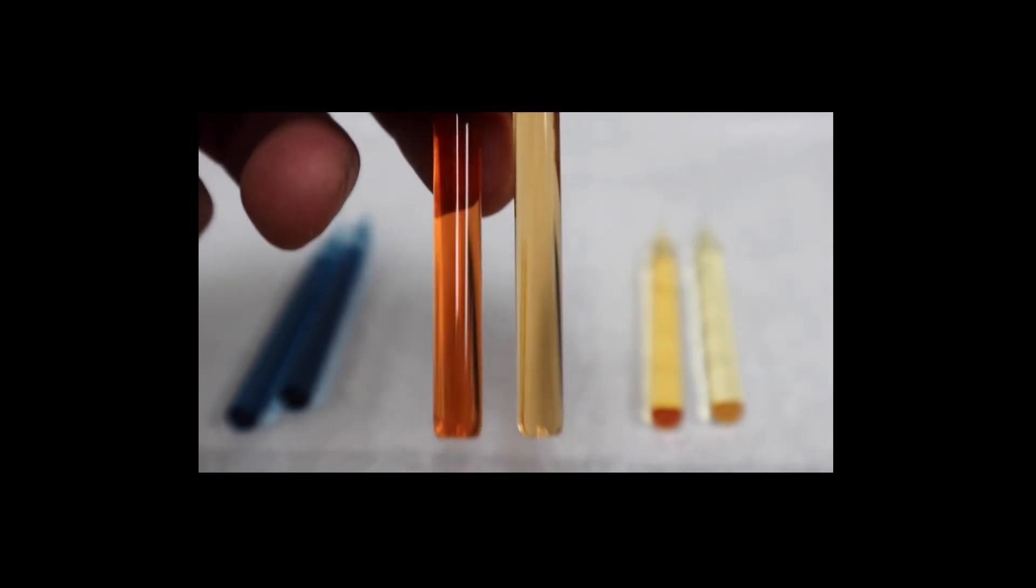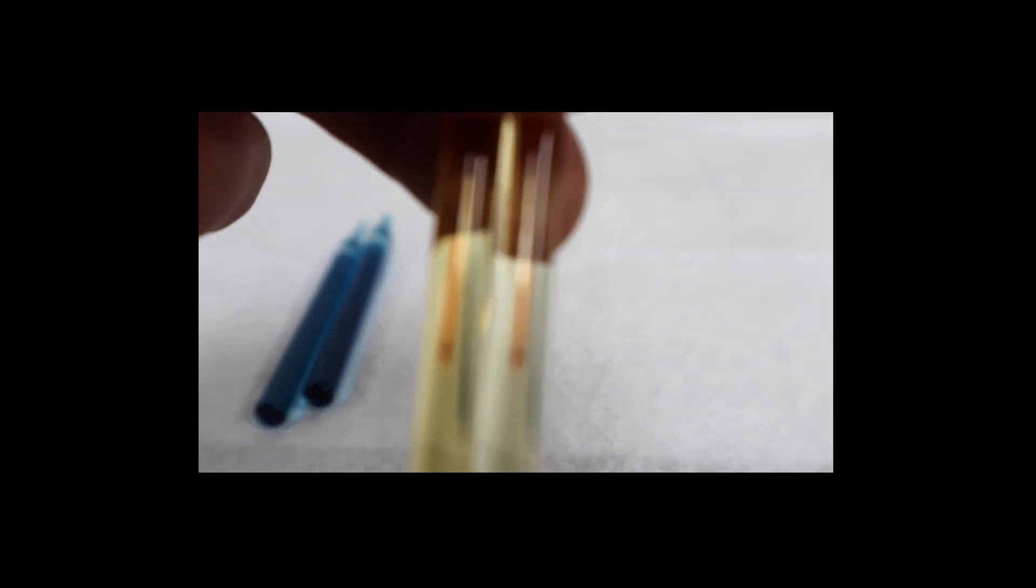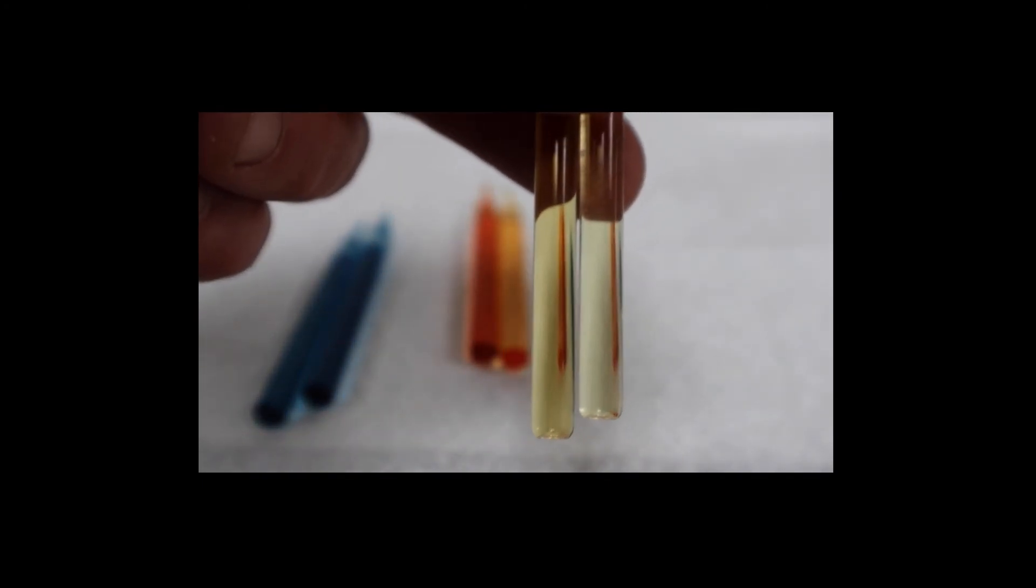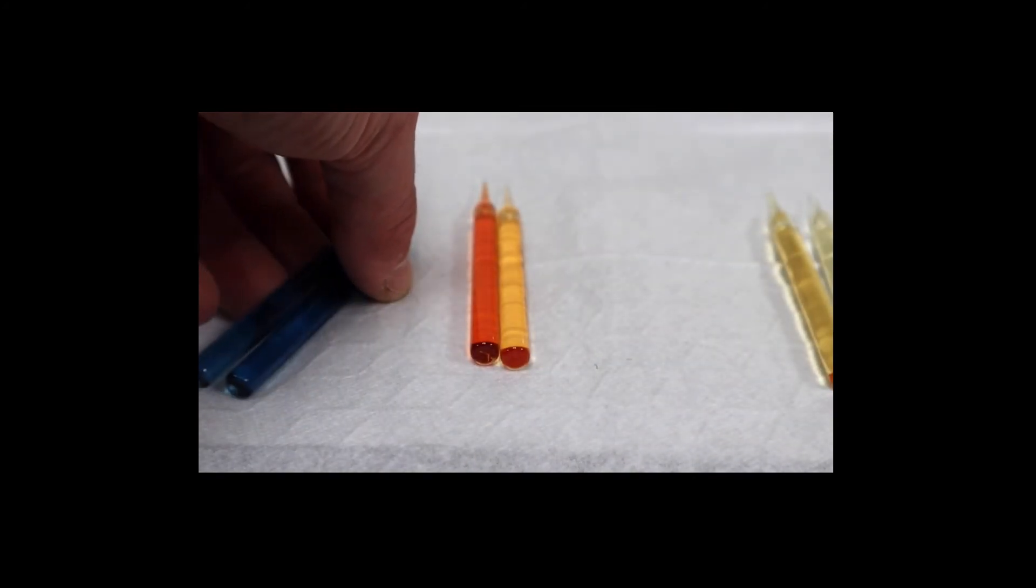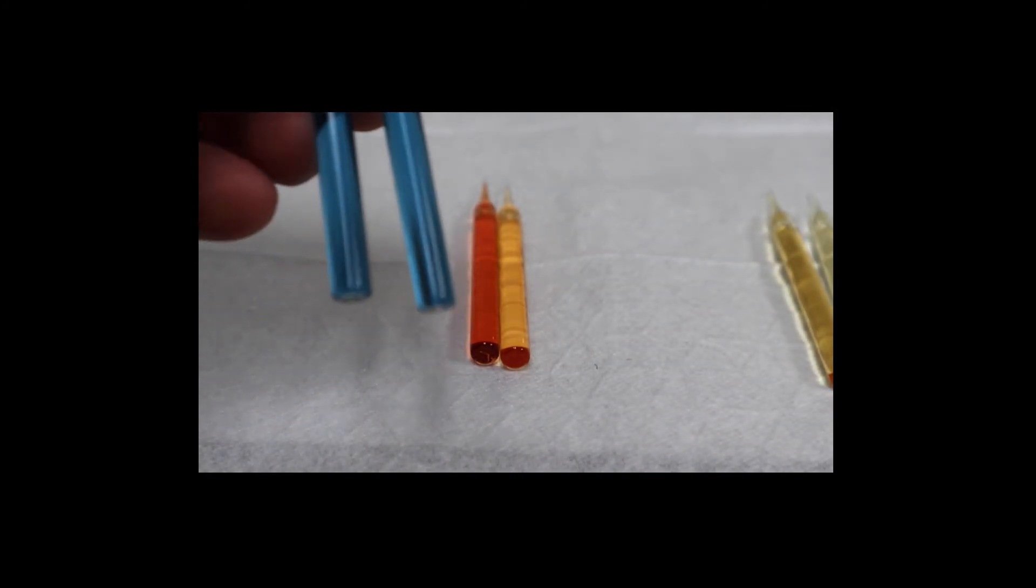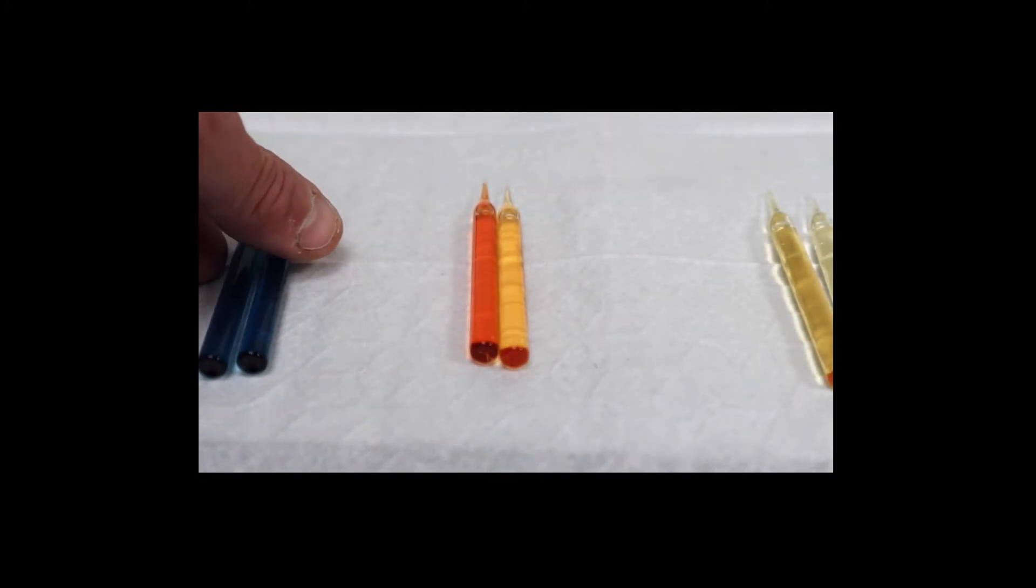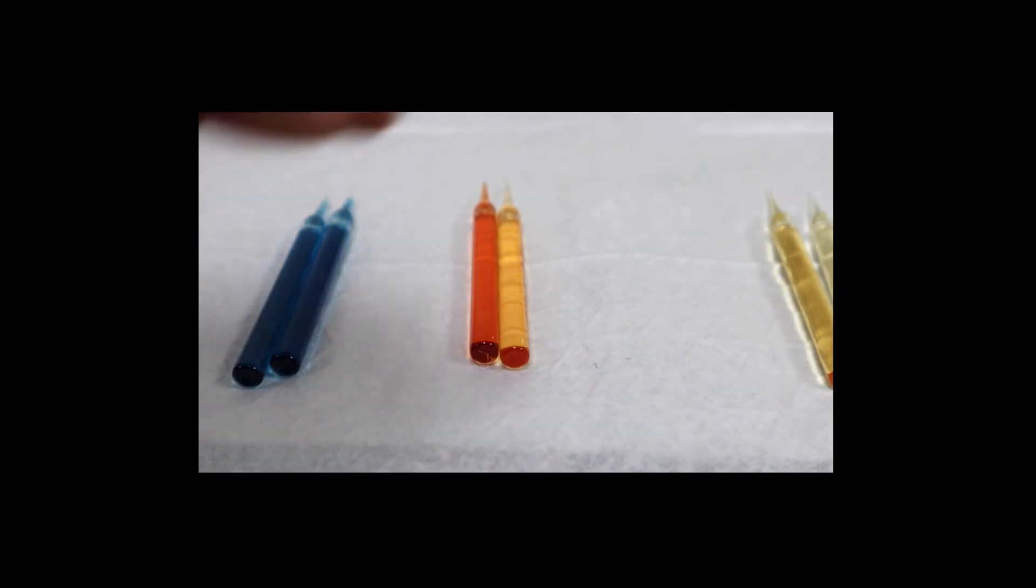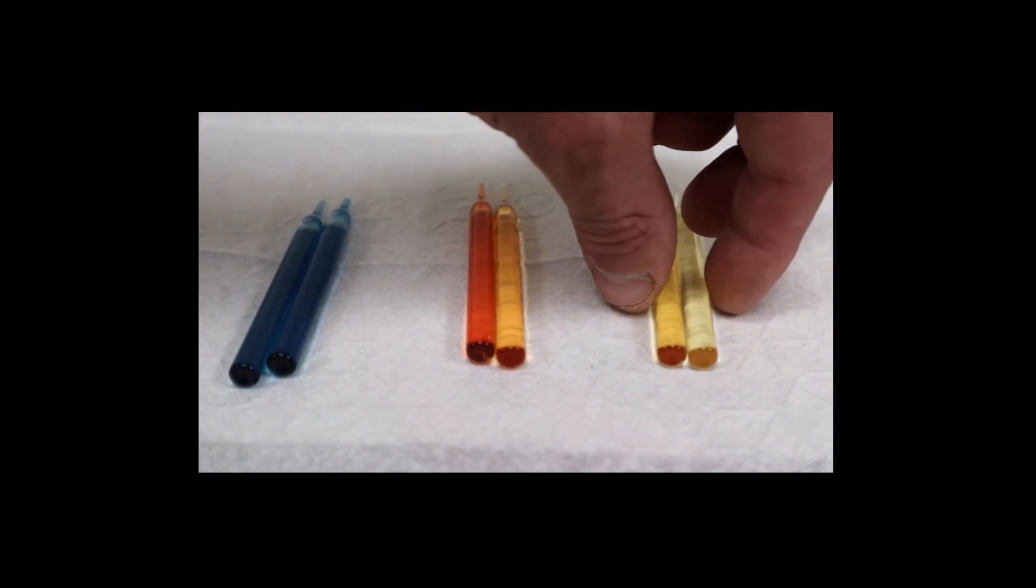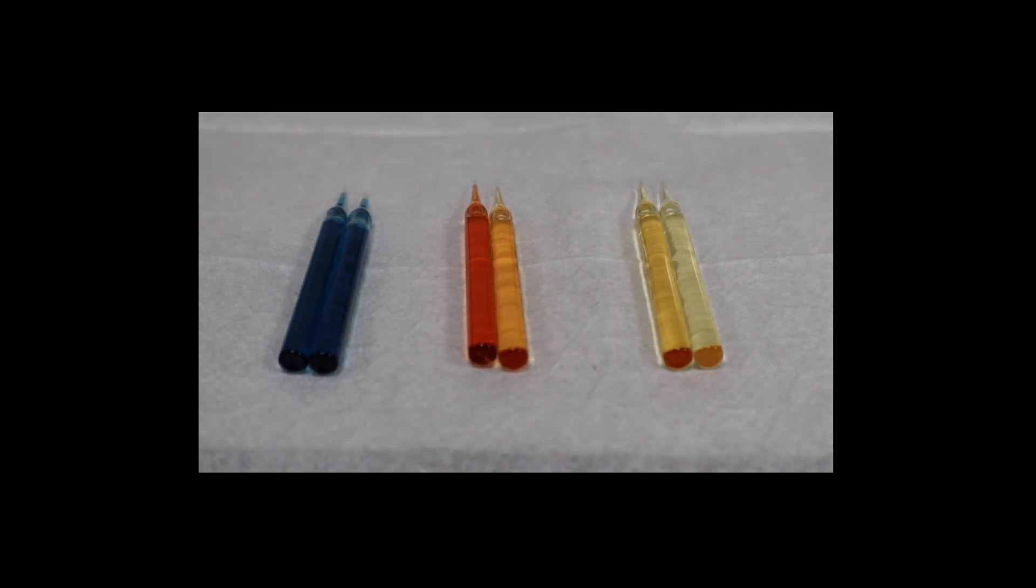A is on your left, B is on your right. You have phosphate blue, copper the orange, ammonia yellow. And again, this is how we test for the concentrations of these contaminants in groundwater or surface waters.